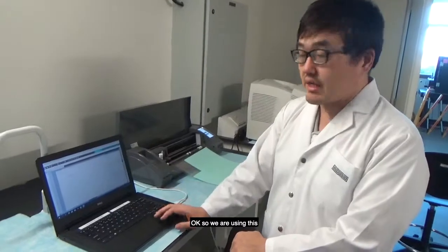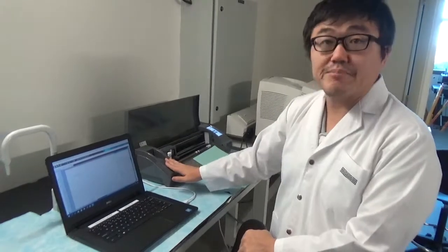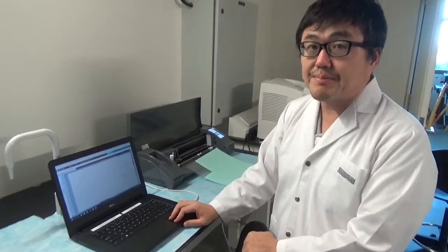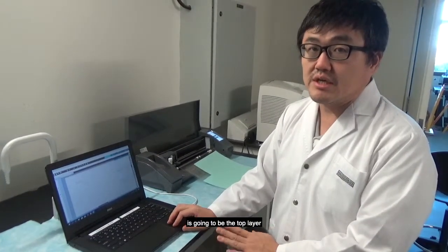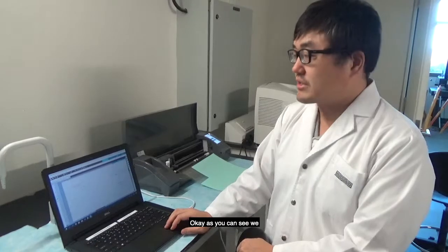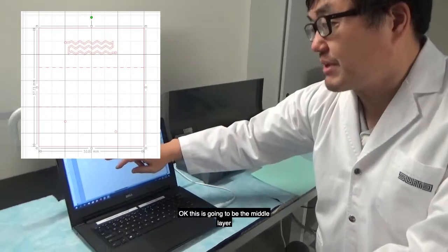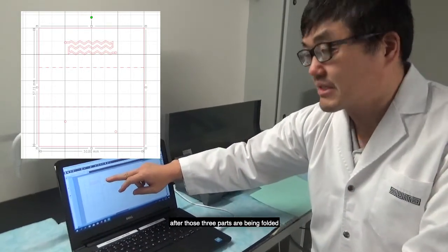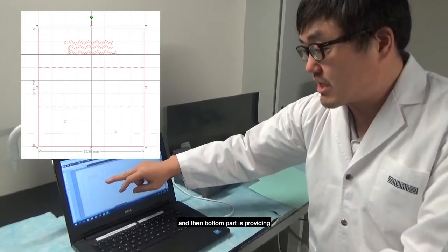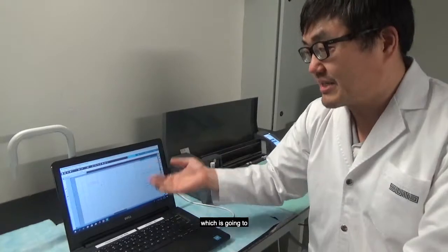Okay, so we are using this CAD software. This is called Silhouette Studio, which is specific to this cutting plotter. The idea of this design is you are creating three parts of the film, which is going to be the top layer, middle layer, and bottom layer of the microchannel. As you can see, we are going to have this channel pattern in the very top. This is going to be the middle layer after those three parts are being folded. The middle part is going to provide the bottom layer, and the bottom part is providing the top layer of the microchannel, which is going to be seen later.